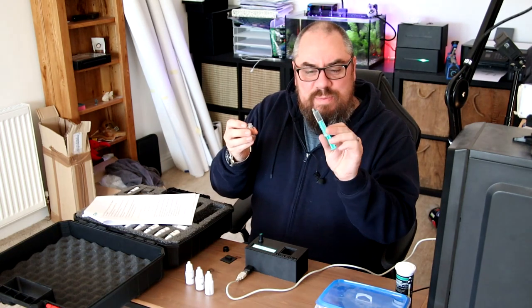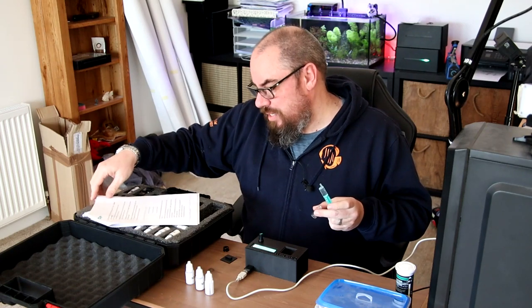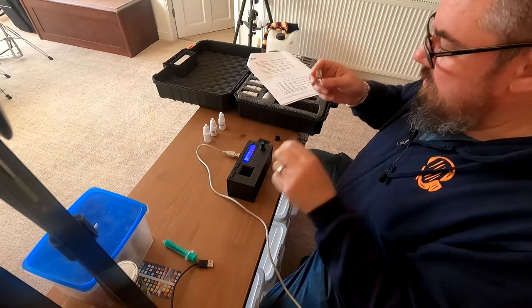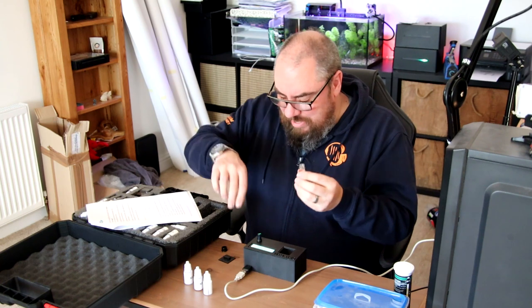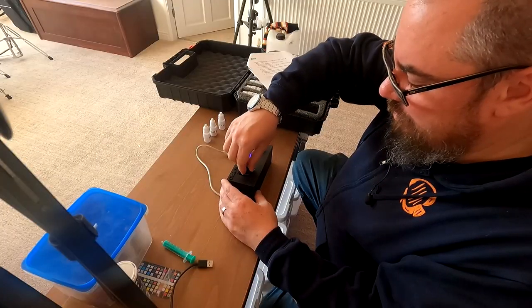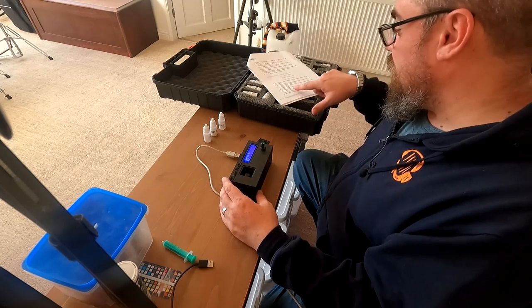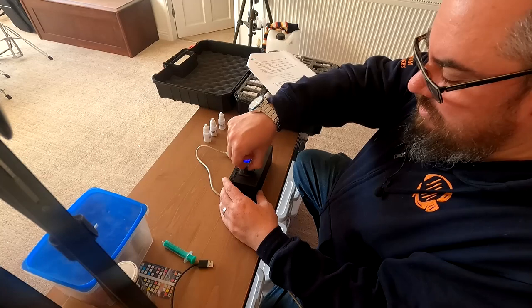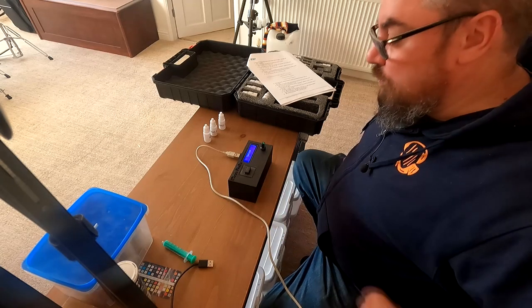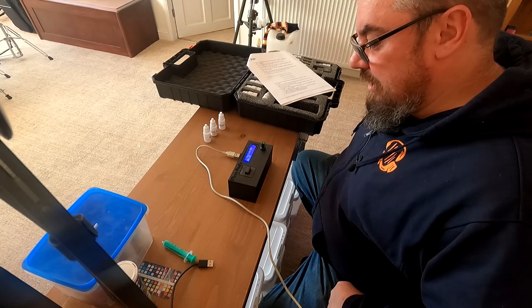We've collected three millilitres of water in a clean test tube and cleaned out the glass. Following the instructions — it's almost three millilitres, so you don't need to use the syringe. We put it in, and as it says, 'Sample Zero' appears on the screen. Click the knob. Testing. Put the lid back on and wait for that to finish. Testing end.